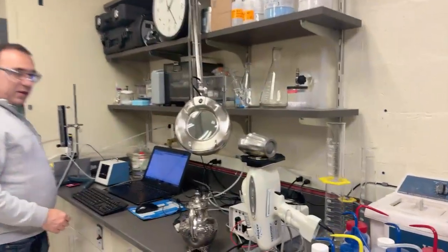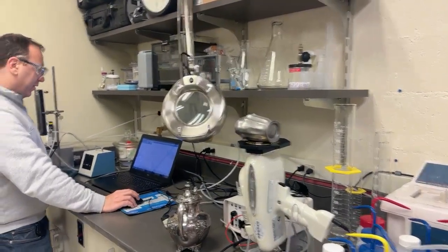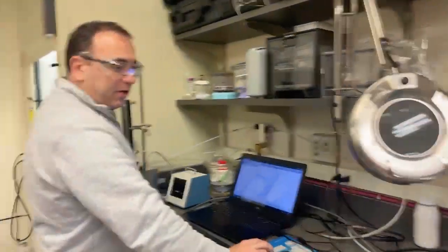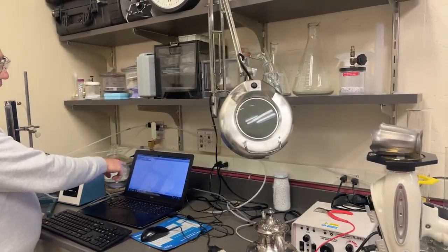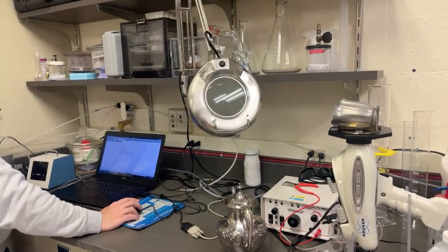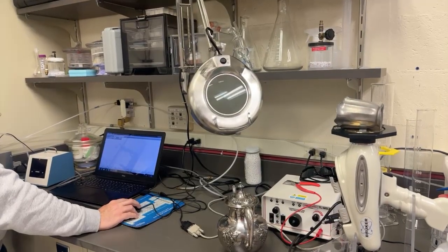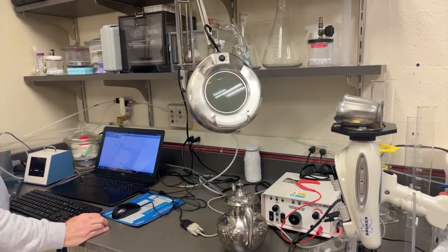Okay, so now I click here, and the process will start. It will take about 10 seconds. So we'll end up having the spectrum here. That's how long it's taking for the signal. So I started now. Okay, cool.